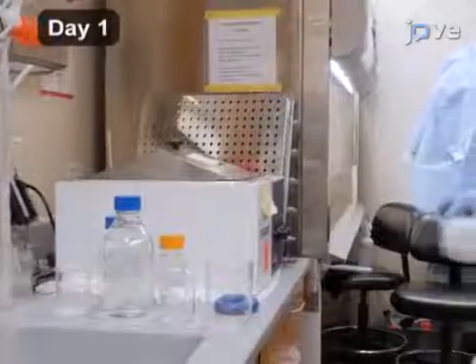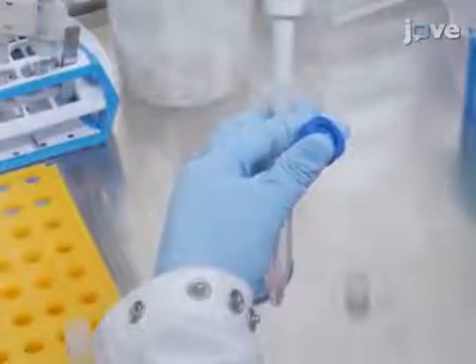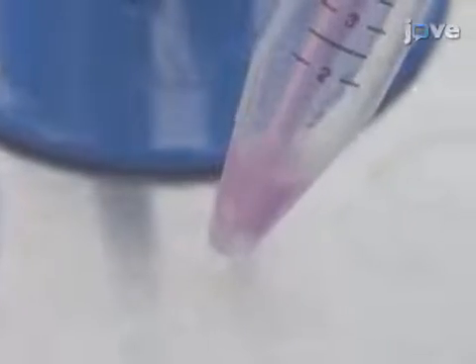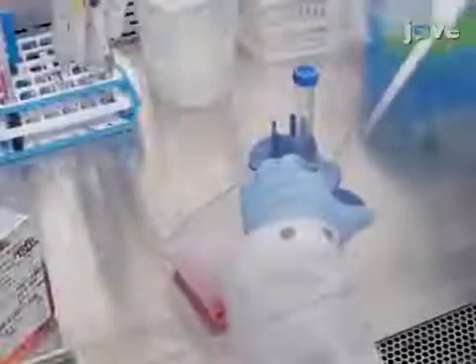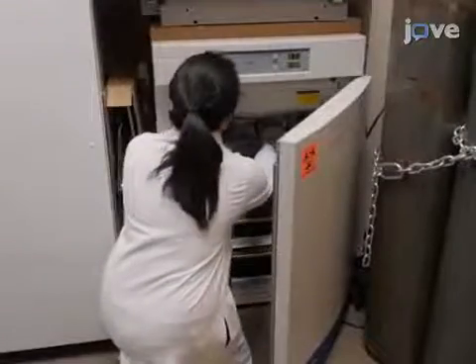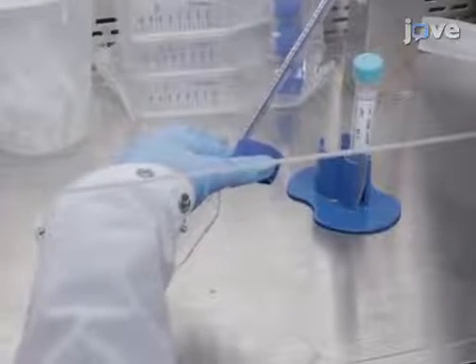Begin by warming a vial of frozen neonatal human dermal fibroblasts in a 37 degrees Celsius water bath. When the cells are just thawed, collect them by centrifugation and resuspend the pellet in fresh neonatal human dermal fibroblast medium at a 1 × 10⁶ cells per milliliter concentration. Then seed the cells in a T75 culture flask for a 72-hour incubation at 37 degrees Celsius and 5% carbon dioxide. When the culture reaches 80% confluency, detach the cells with 5 milliliters of trypsin EDTA.